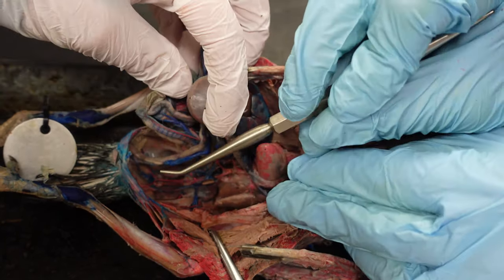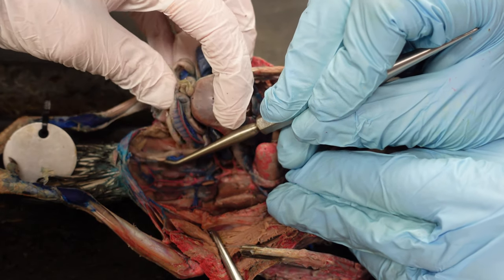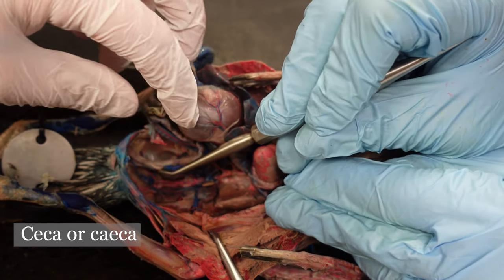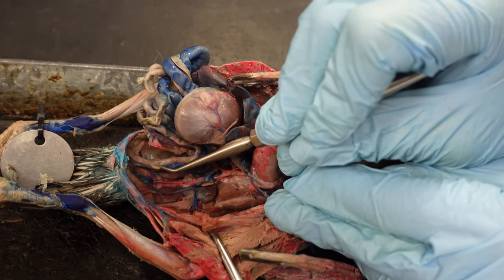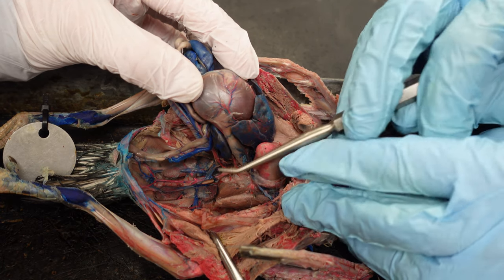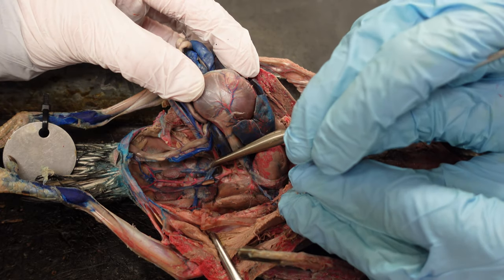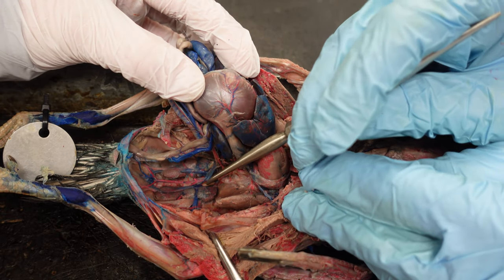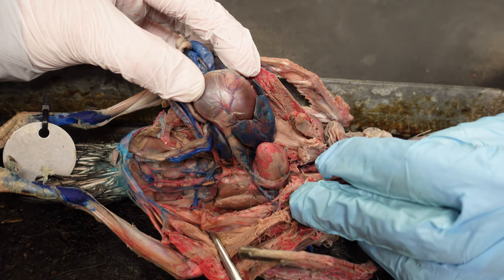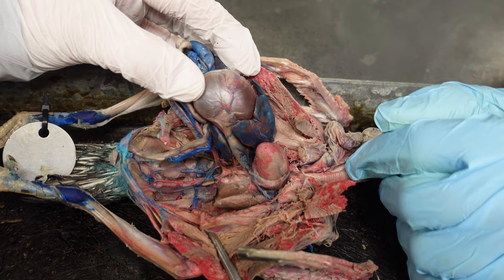And then last but not least on the intestine, we have these two little structures — those are the ceca. You can see one and the other one might be kind of hard to see. This particular pigeon is a male, and we can tell because we can see this very tiny little testis. And the other one is right over here. Those are the testes in this probably non-breeding season male, or maybe an immature male. In some that are in the breeding season, the testes get to be very large.